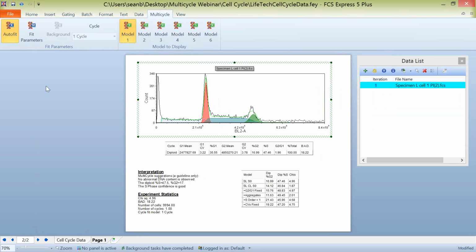So coming back to our standard 1-cycle population, I want to start talking about what happens in the cases where you need to start doing some manual adjustments to this data. Maybe where the autofit isn't quite fitting exactly as you had planned. Maybe there's some kind of variability within your data that you need to adjust for. That's when we can actually turn off this autofit function. And when we turn off the autofit function, we'll have the ability to come in and change our models. So we can compare different models. We can change what's being included with the background and some of our fit parameters.